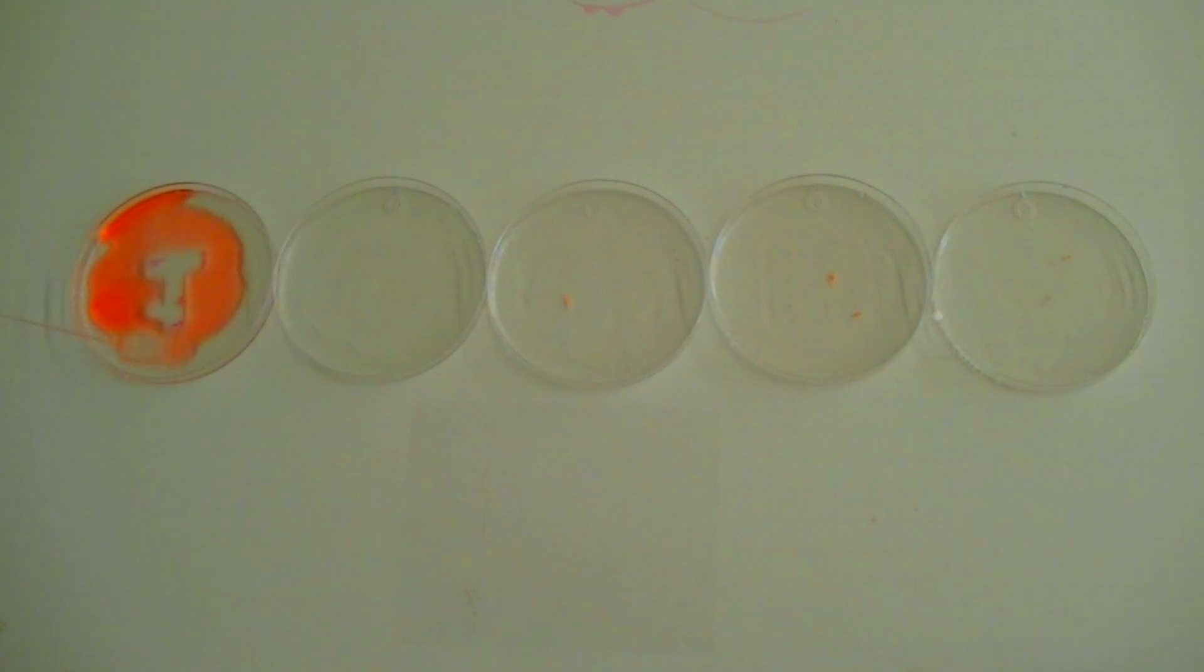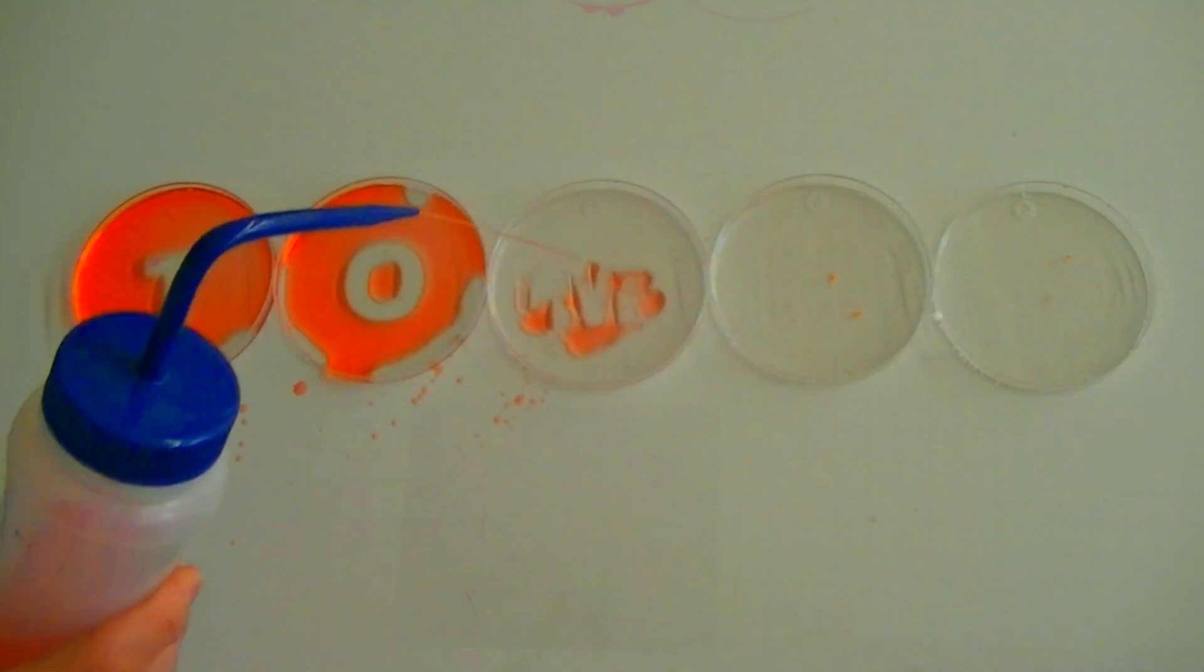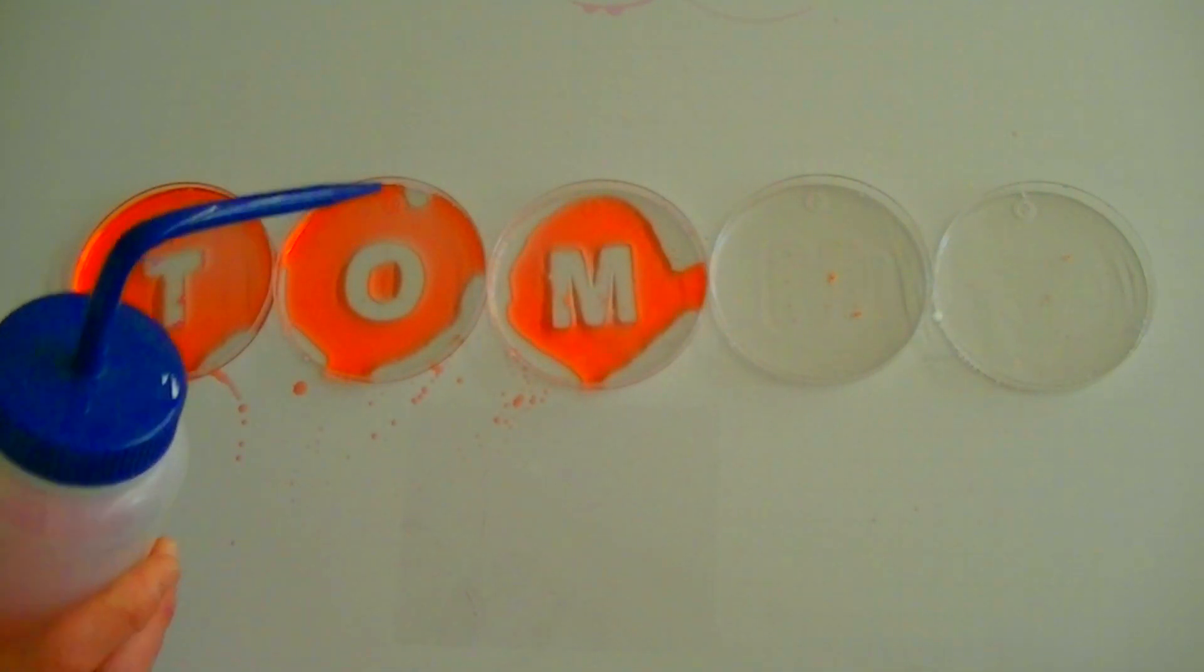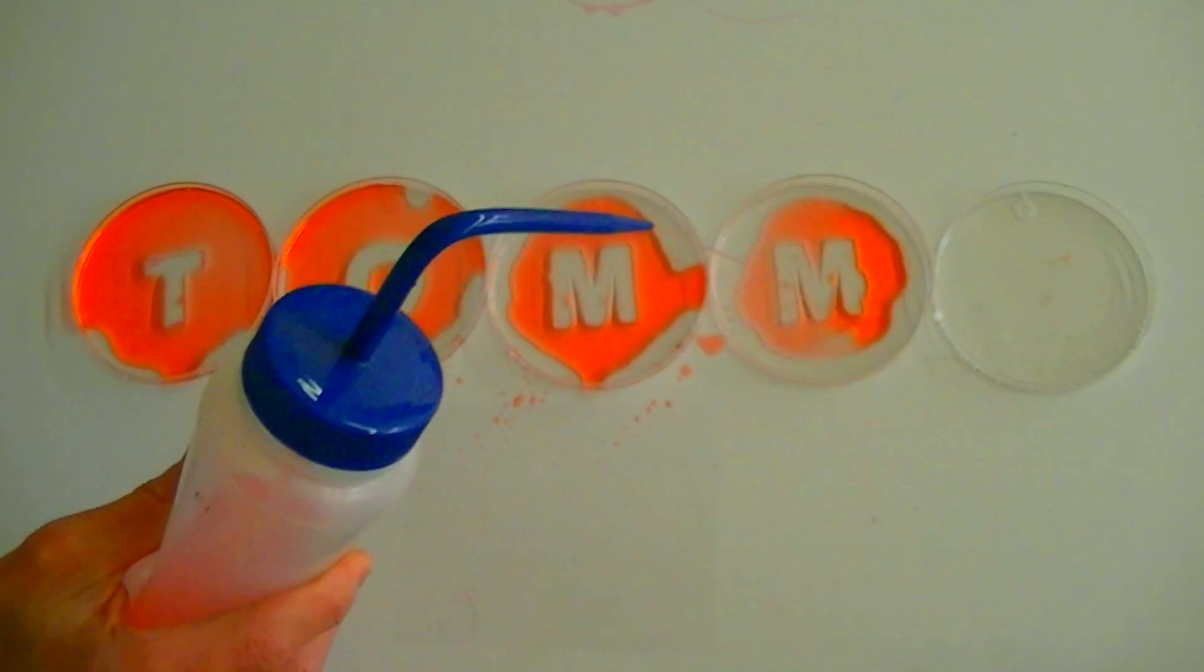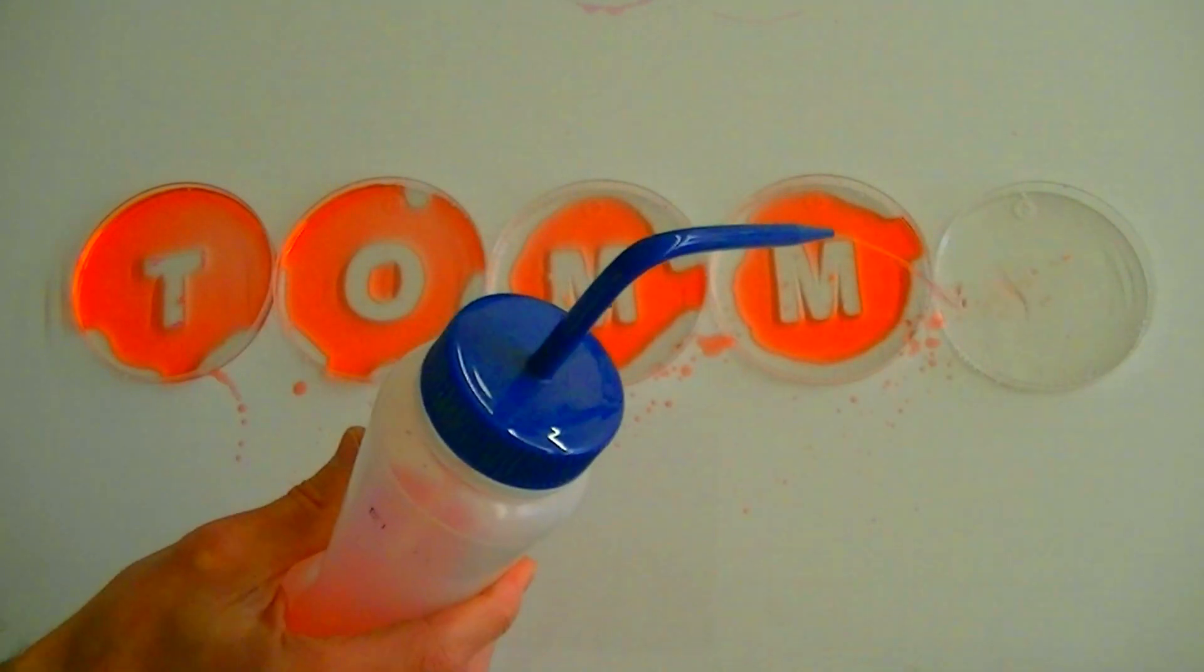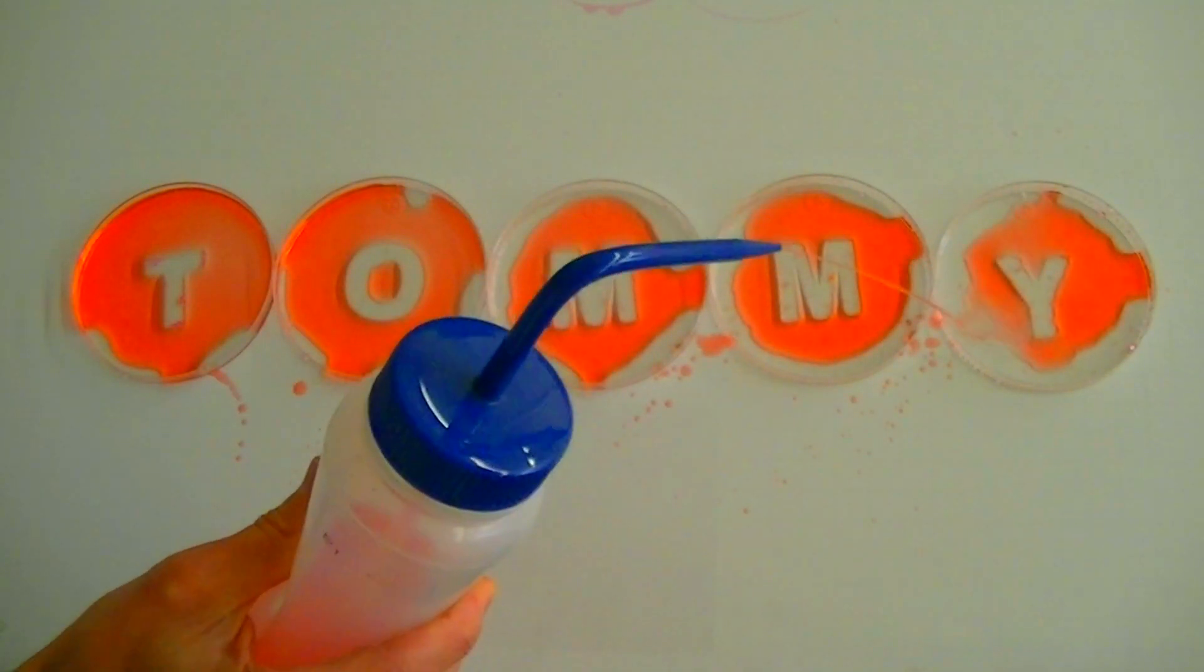The surface of these plastic dishes have been chemically modified so that only part of each surface interacts with water. In this video I will show a simple way to modify certain surfaces to achieve this effect. I will also discuss some of the chemistry involved.